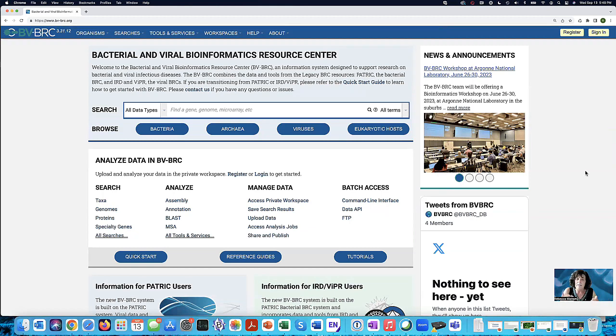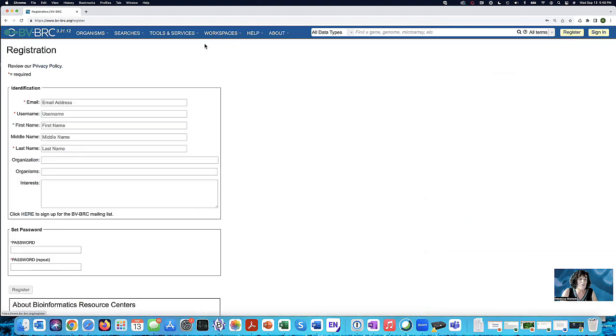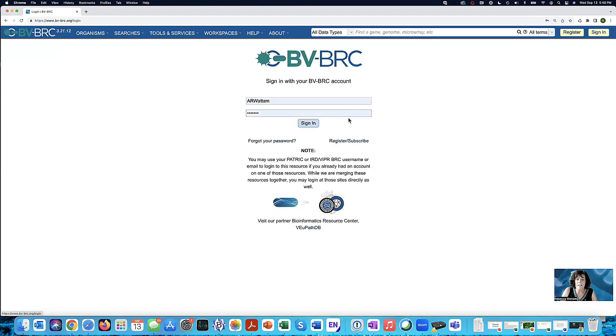And the main reason they ask you to do it is so that they can give you your own private workspace where you can keep your data private. Nobody else can see it. You would have to go here and do register, and they ask for your email. You have to have a username that you would use, your first and last name, and generate a password. But I'm already registered, so I'm just going to sign in.